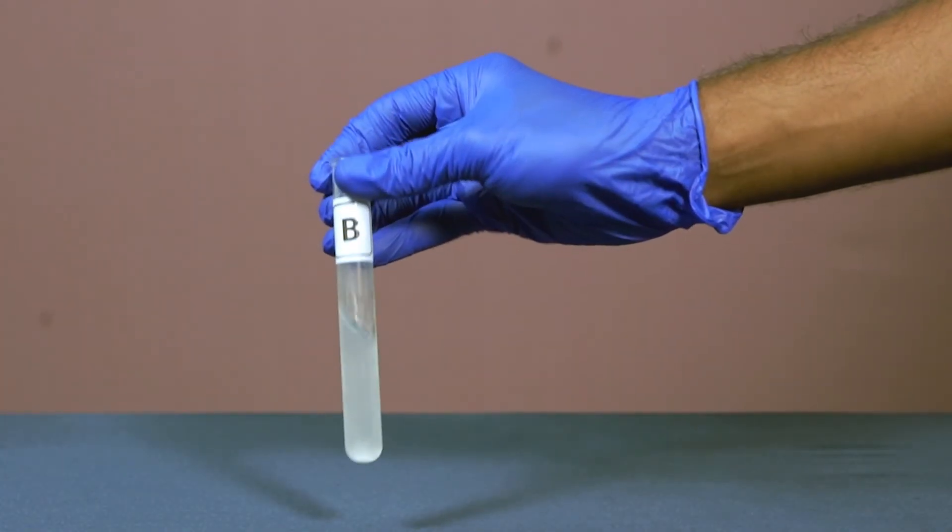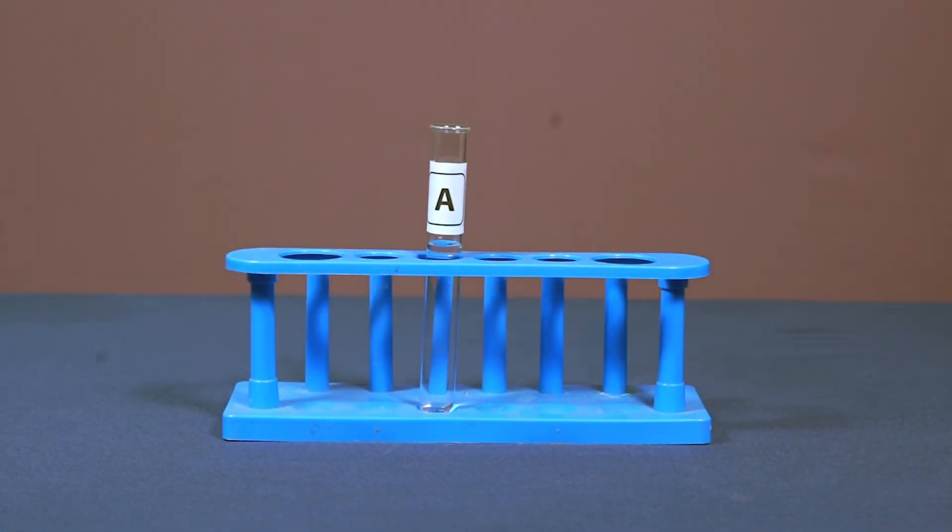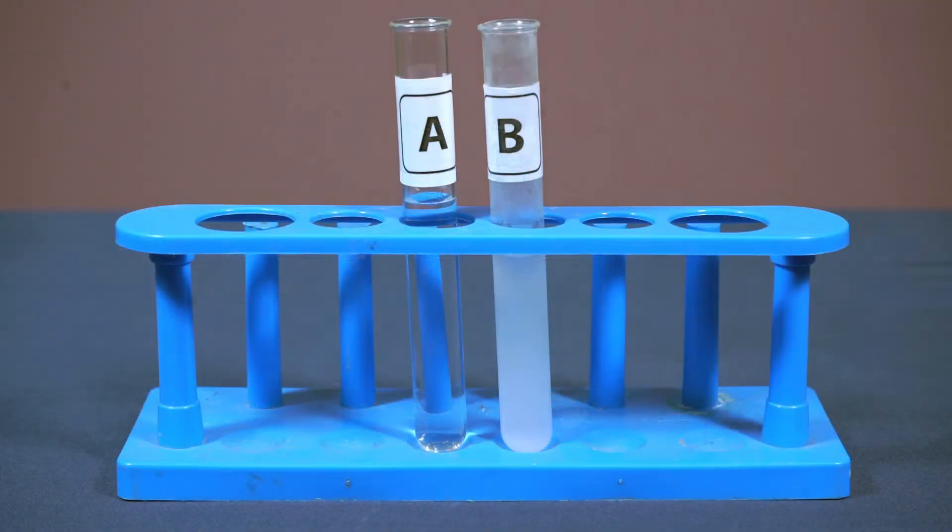Then shake the test tube. Observe both the test tubes carefully. Compare the color of solutions in both the test tubes.